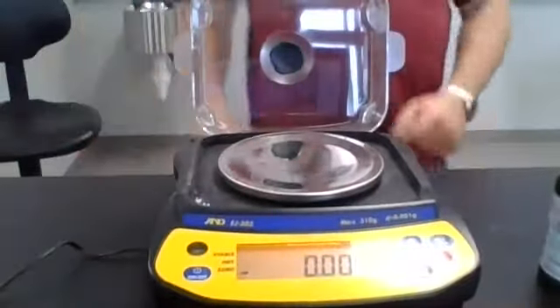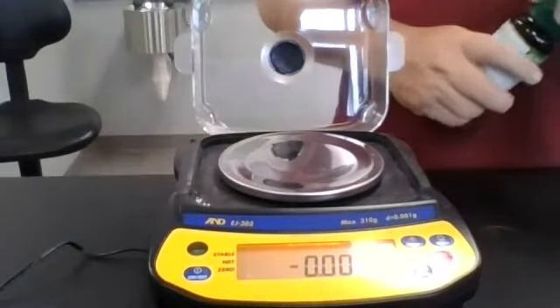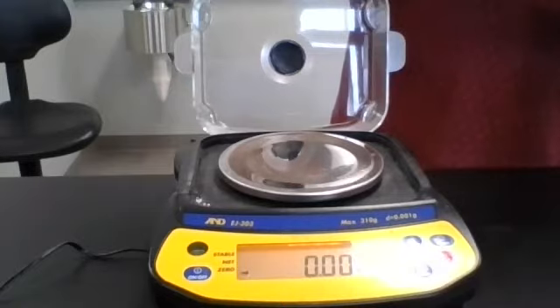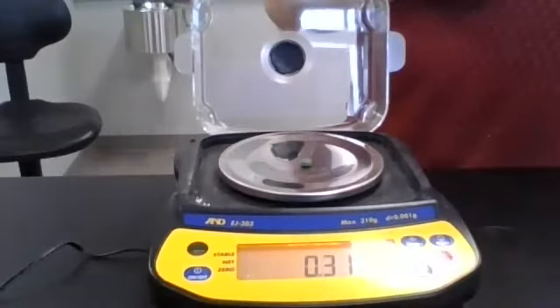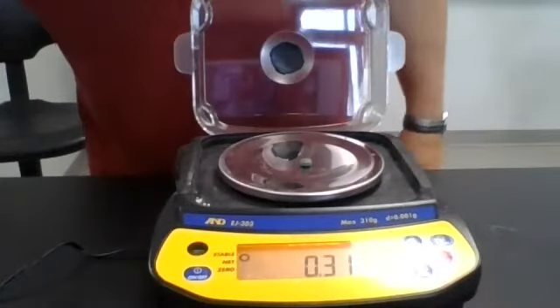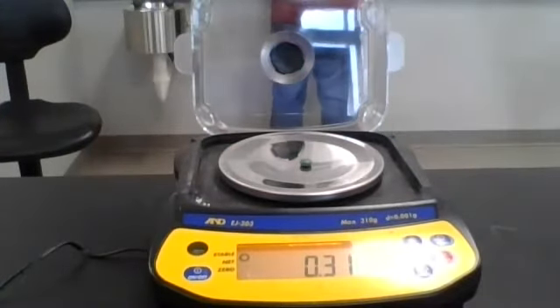So I am going to start by taking my iron tablet and weighing it. I am going to tare the balance, and hopefully you can actually read it. I will say the readings out loud, but hopefully you can read what the balance says. I'm going to start by putting an iron tablet on there. Here is our iron tablet. As we see, it says 0.313 grams. I'm going to write that on the board.